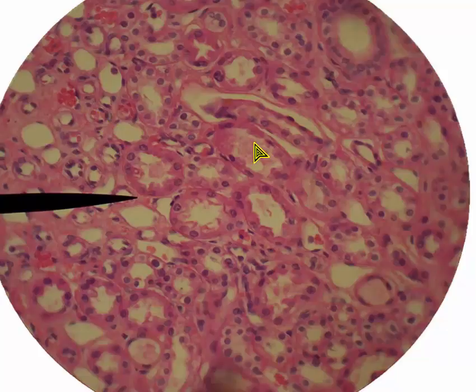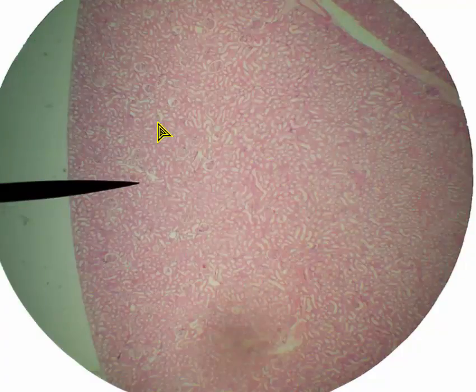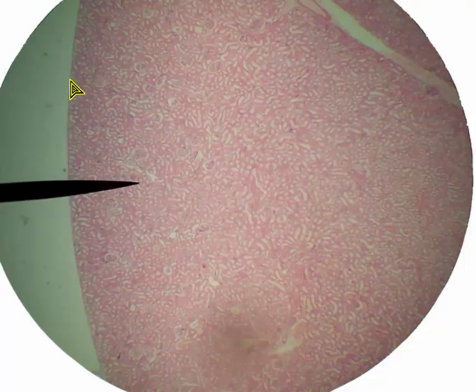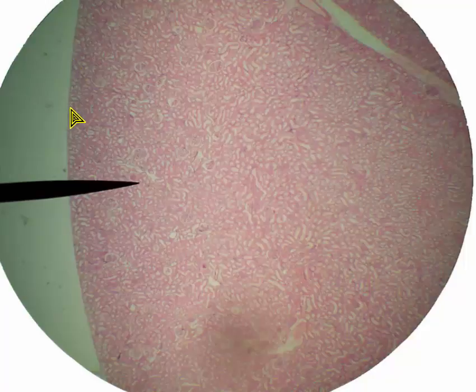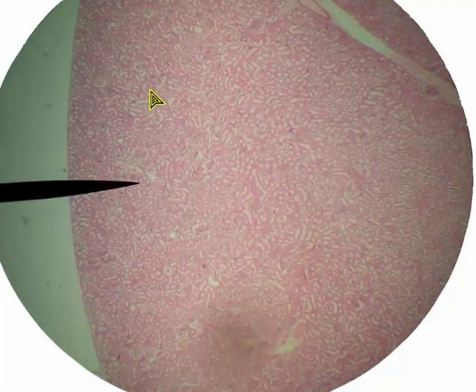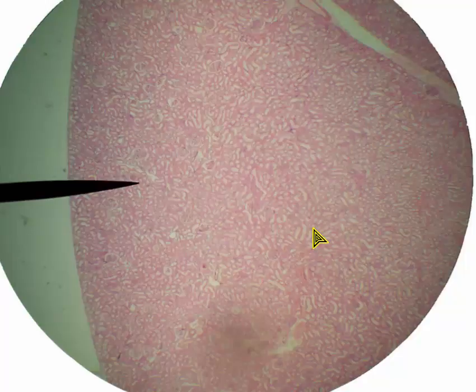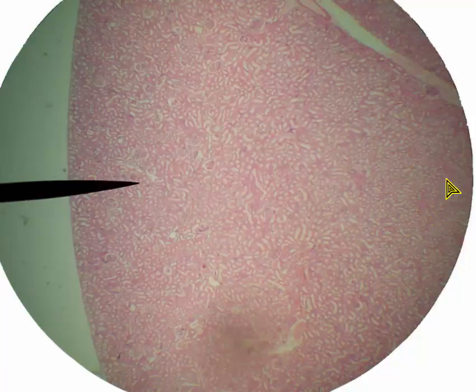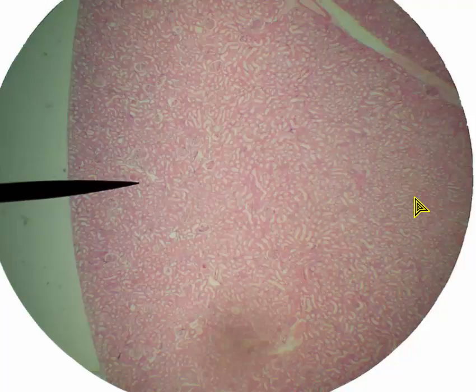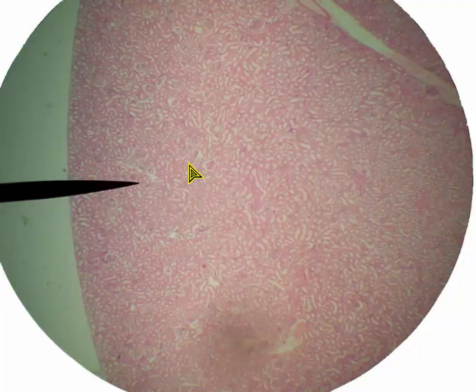This is medulla 450 times magnification. Moving on, this is a different kidney — this doesn't come from a human, this comes from a mouse. We can see the outside part of the kidney, so this might be renal capsule, and just inside would be cortex. I can tell for sure it's cortex because I see renal corpuscles. If we go far to the right, we see an area where there's no renal corpuscles — so this is the medullary region. The nice thing about the mouse kidney is because they're smaller overall, within the same view at 40 times magnification you can see both the renal medulla and renal cortex.